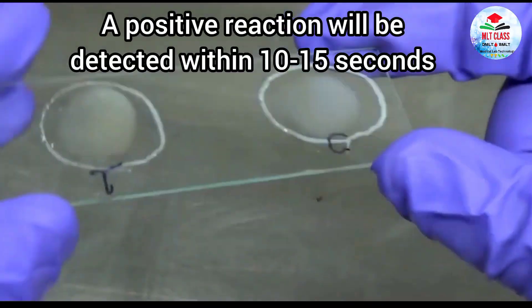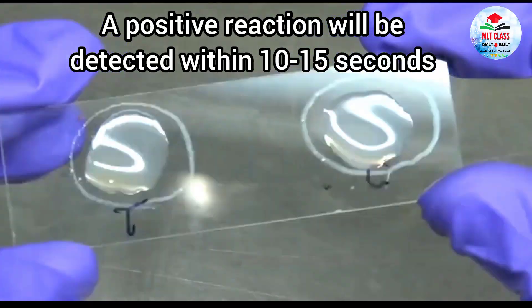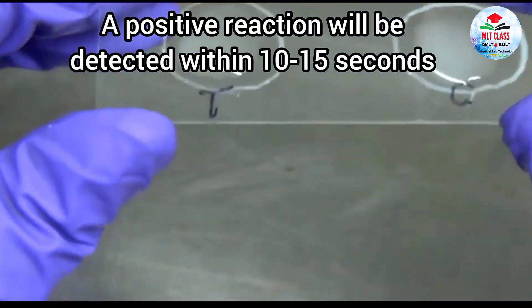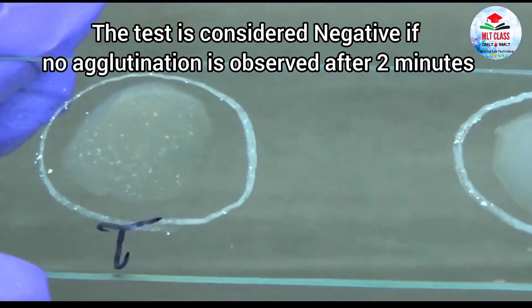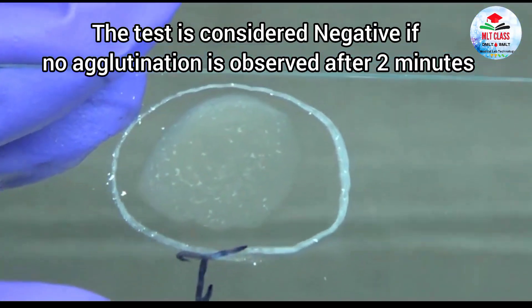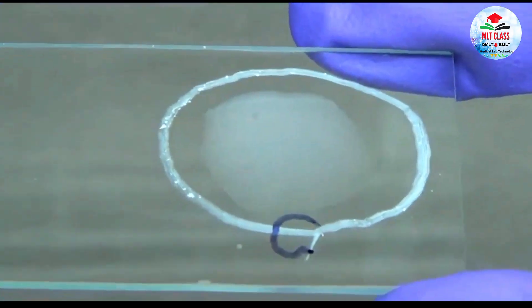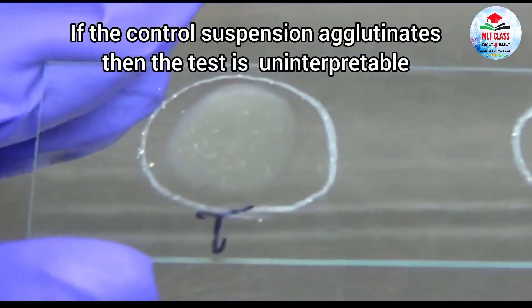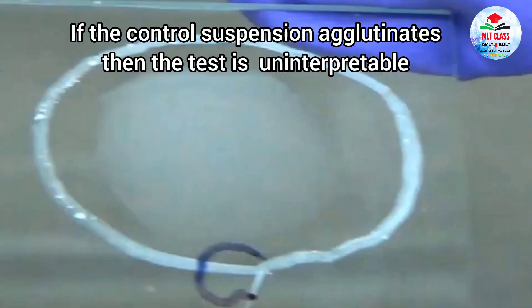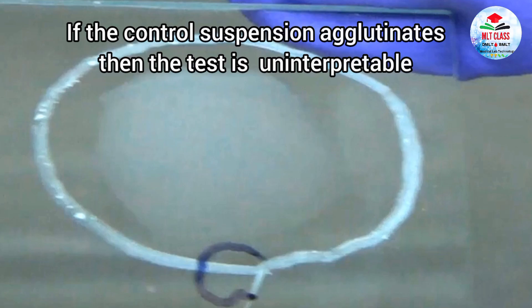A positive reaction will be detected within 10 to 15 seconds. The test is considered negative if no agglutination is observed after 2 minutes. If the control suspension agglutinates, then the test is uninterpretable.